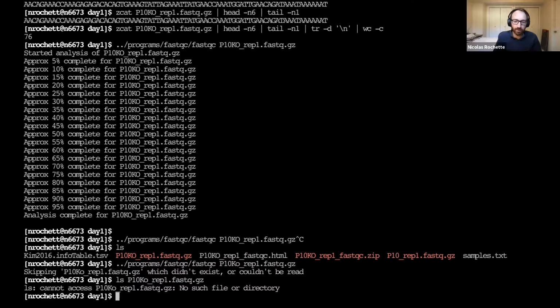And this is just the first step of confirming that this is the cause why your bigger program or bigger command line is not working, because then you have isolated the error and you can fix it. And then once you fix it with ls, then you can apply the same fix to the bigger command line and fix the bigger command line. And usually that's the fastest way to fix a big command line.